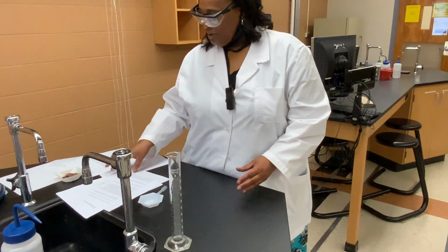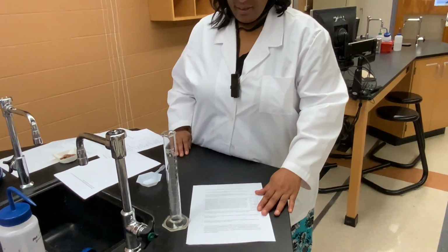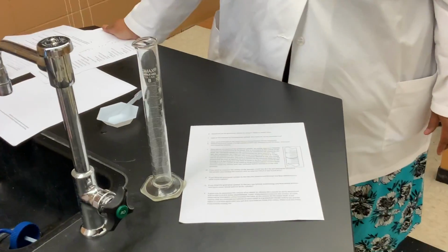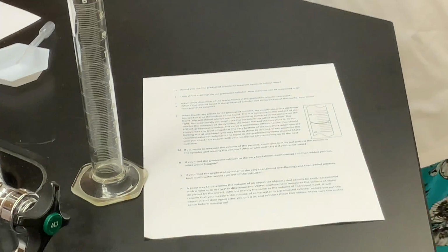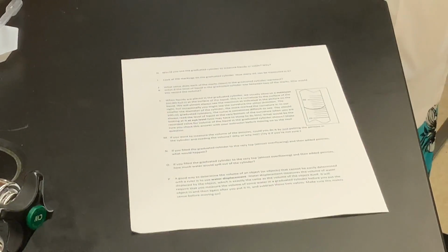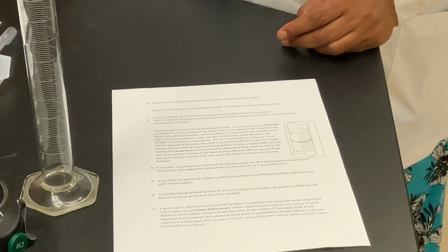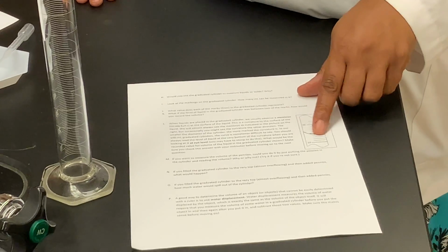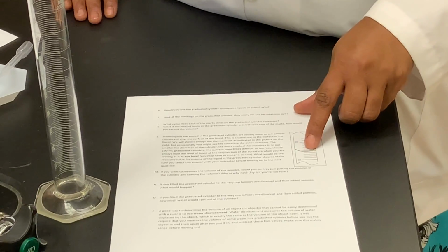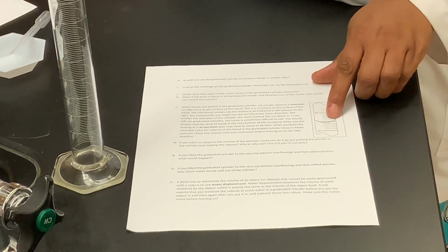Question L, you're going to use the picture that is provided for you on the data sheet for question L. So when we place liquids in our graduated cylinder, we usually observe what's called a meniscus. The meniscus is a curvature that we see at the surface of that liquid. So we will almost always see the meniscus as indicated in this picture here.